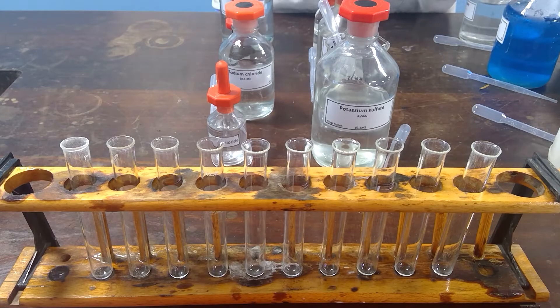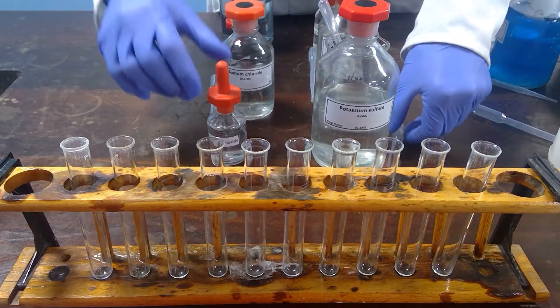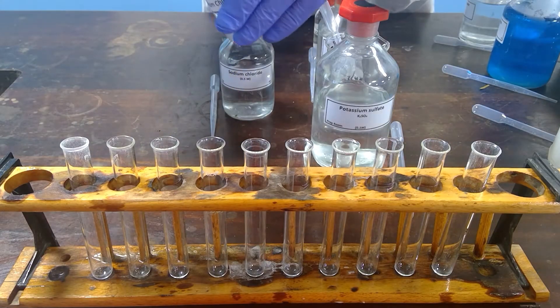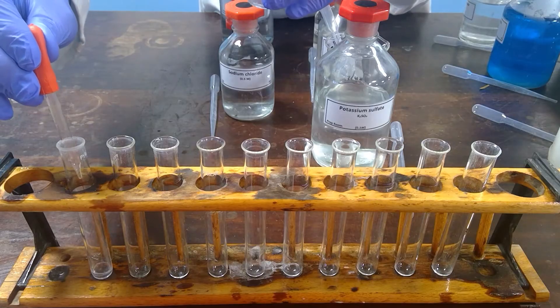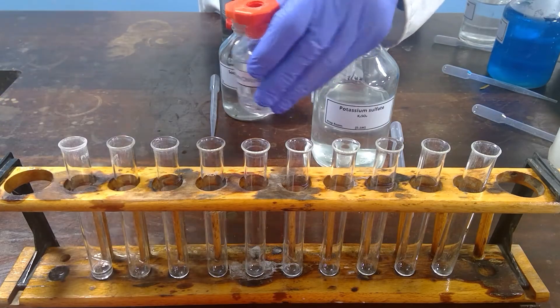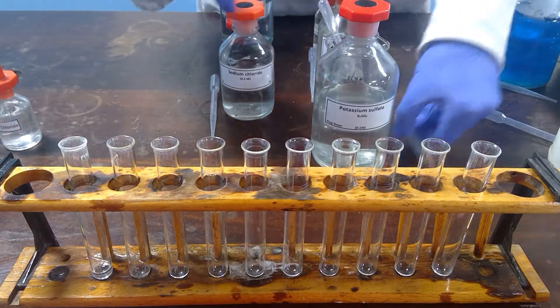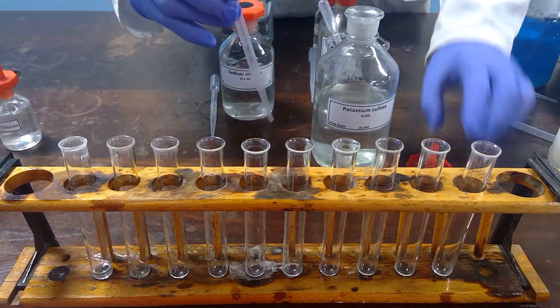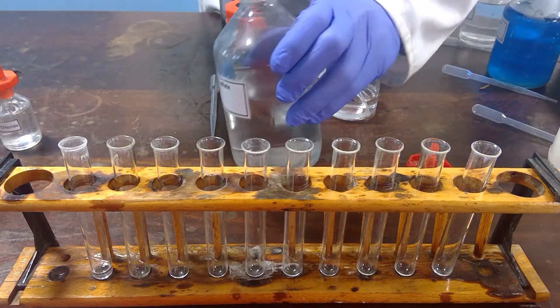Experiment 1: barium chloride and potassium sulphate. A few drops of colourless barium chloride solution are combined with a few drops of colourless potassium sulphate solution.